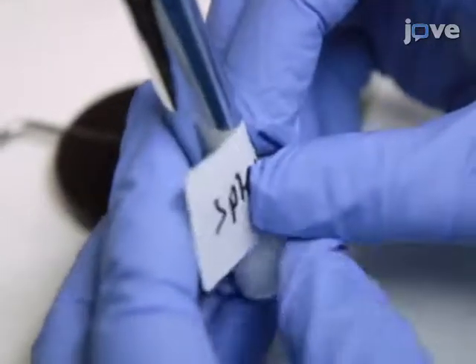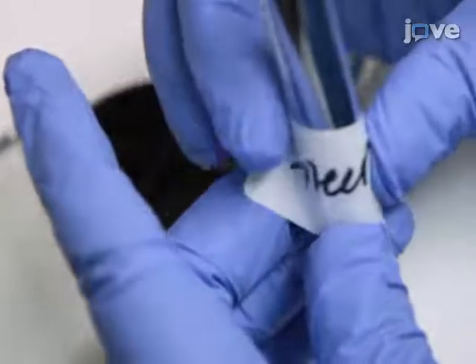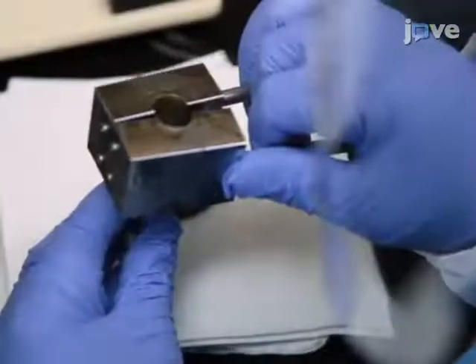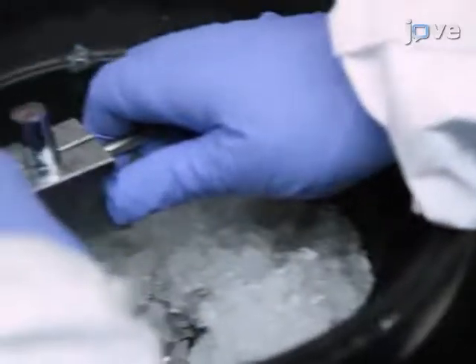Label the plungers with the relevant tissue information. Then place the samples in a chilled holder in an ice bucket.